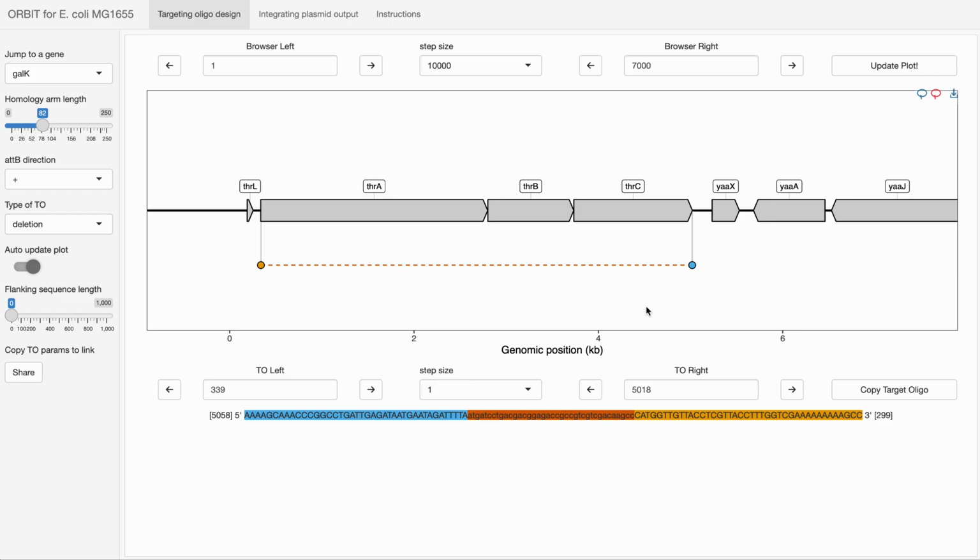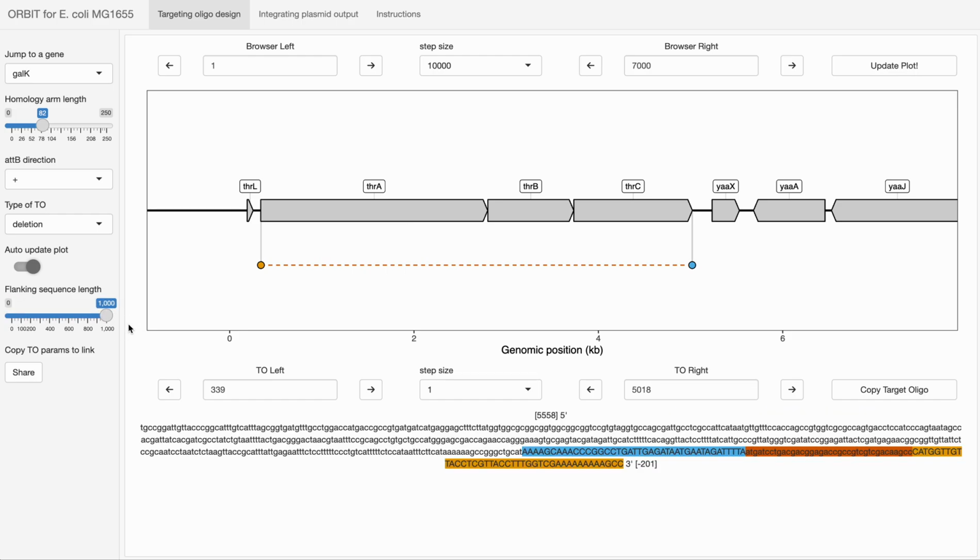The final 2 things that you'll see here that I did not previously explain are that this slider controls the flanking sequence length. This is if you rapidly want to just obtain the genomic sequences around your Orbit integration. For example, if you want to quickly design colony PCRs, you just ramp that slider up. And this is kind of weird because we're at the very first position. It doesn't go circular, which is a slight bug.